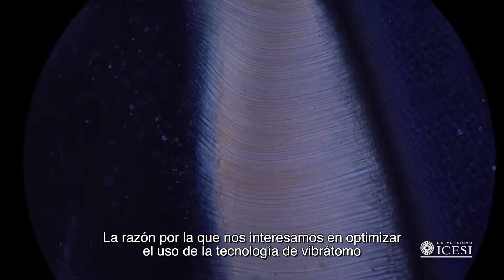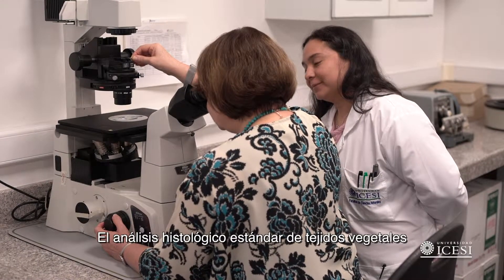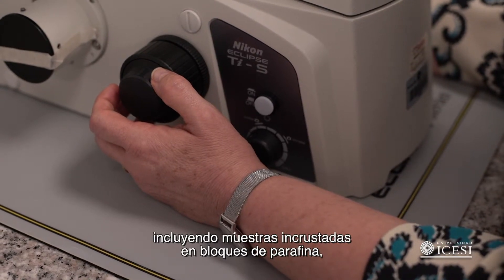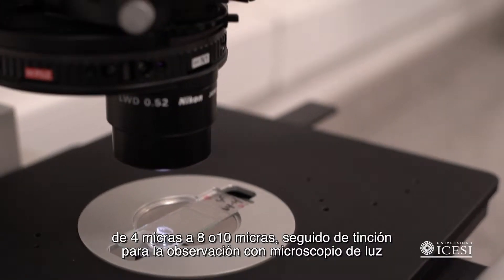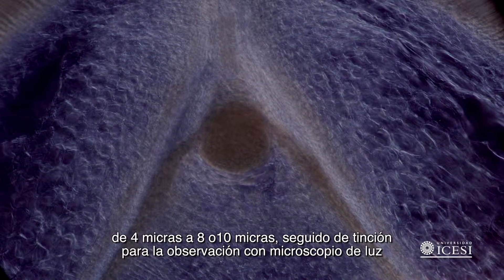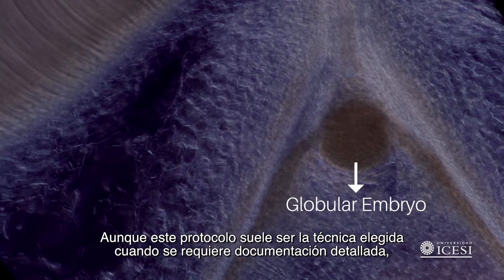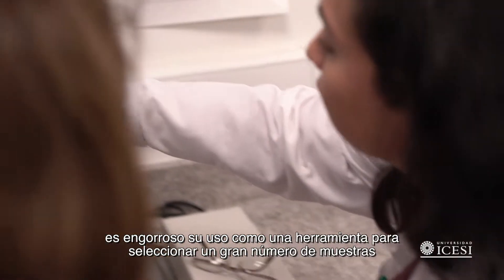The reason for optimizing the use of vibratome technology was to reduce the number of ovule slide samples needed for analysis compared to microtome technology. The standard histology analysis of plant tissues involves embedding samples in paraffin blocks, which are then sectioned with a microtome in thin slices from 4 to 8–10 microns, followed by staining for observation with light microscopy. Although this protocol is the technique of choice when detailed documentation is required, it is cumbersome for screening large numbers of samples.